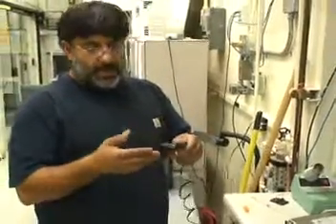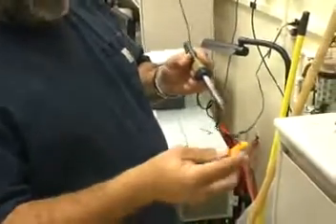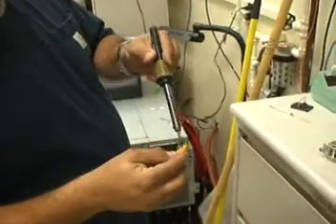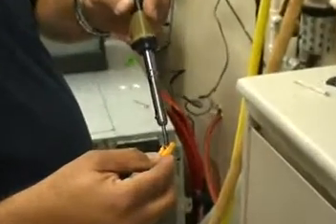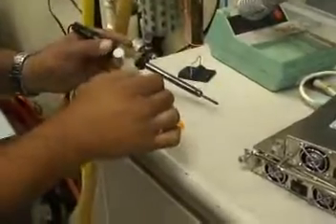The next thing you need is a heater — probably a soldering iron or anything hot — and a piece of wax. You can buy this commercially in many places. You melt the wax a little bit at a time, make a little puddle of wax, and while the wax is still liquid you take your capillary, which has the crystal inside, and gently touch it to make a little bubble of wax. Let it cool and repeat the process a couple of times to form a little ball of wax at the end.